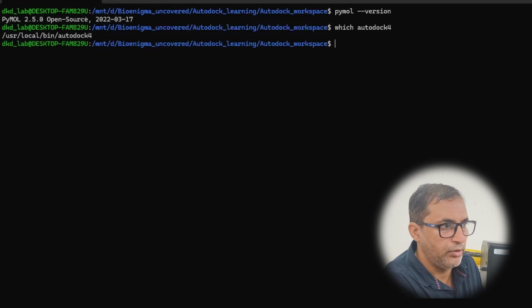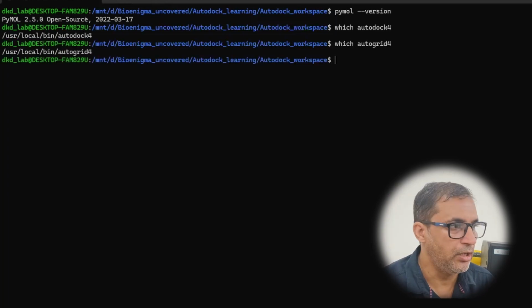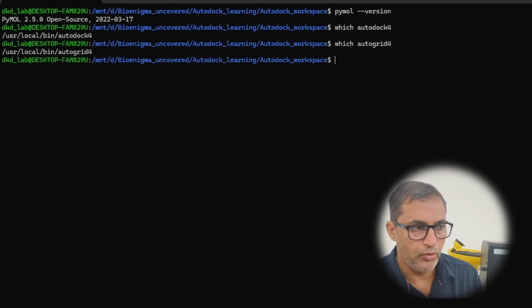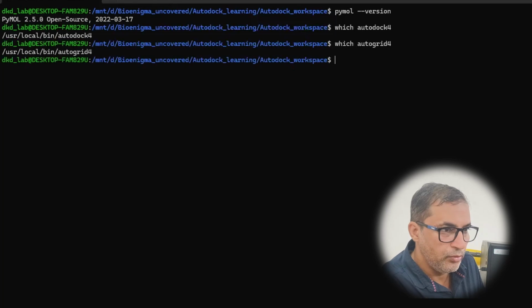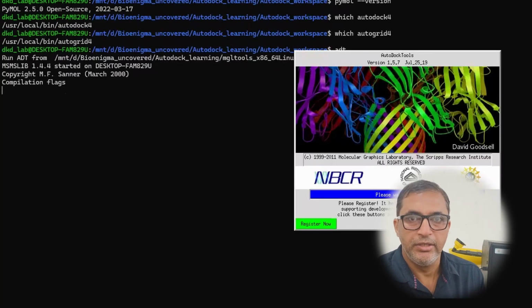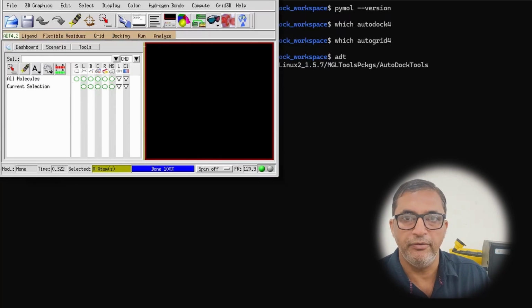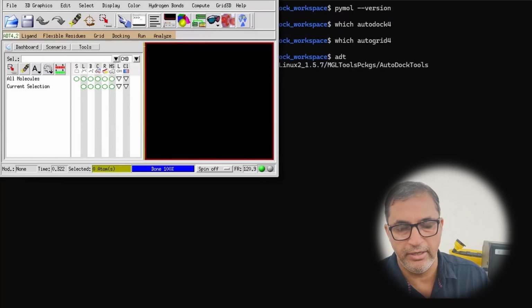Next, we are also going to run which autogrid4. We are going to type this command, hit the enter button, and it will give us the location of AutoGrid. So finally, we are going to run the command ADT, and you can see here the workspace or the graphic user interface for the AutoDock 4 is now clearly visible and running.